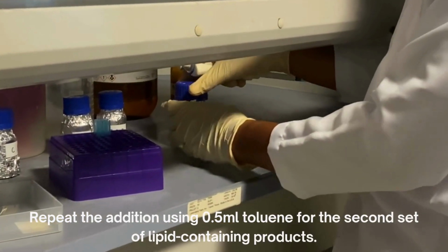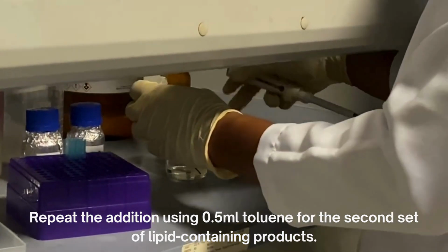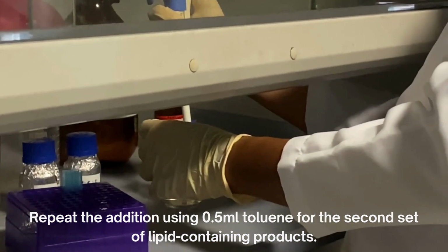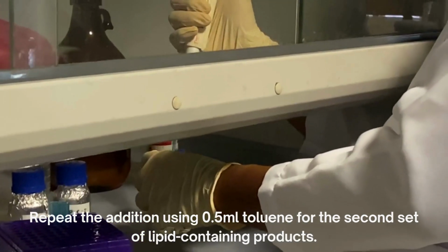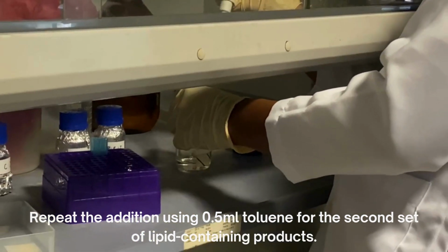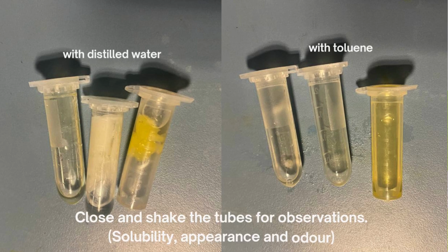Repeat the addition using 0.5 ml toluene for the second set of olive oil, ghee, and shortening. Close the lid and shake well. Observe for the appearance, odor, and solubility in water and toluene.